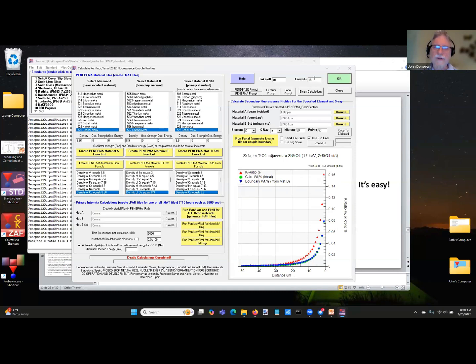And if we increase the energy, because we want to get good sensitivity, we want to really zap the sample, it actually gets worse. It goes from 800 ppm, I think, to about 1,000 ppm. Let's see what it does here. Yeah, up to 1,000 ppm. So, model it. See what happens here.